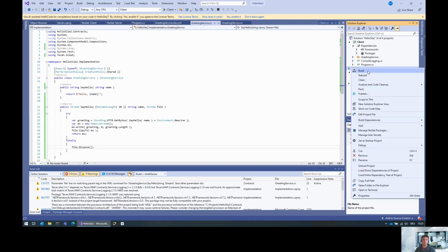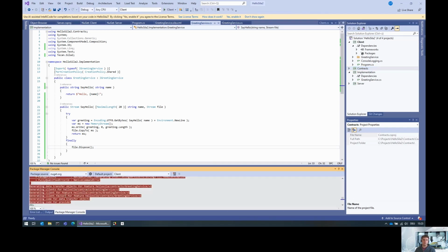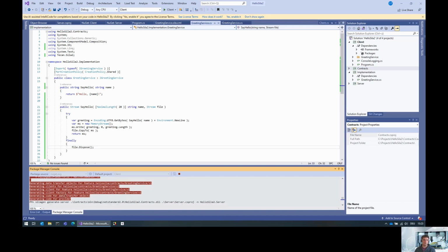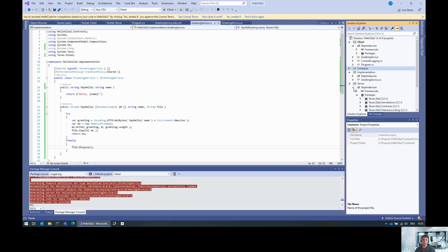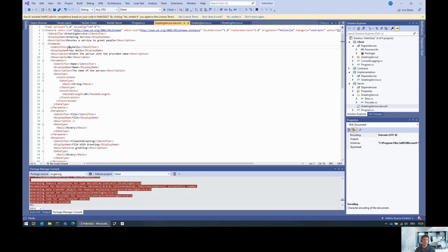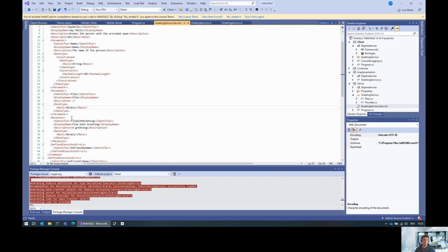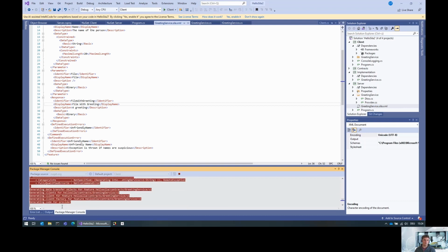So we did change the contract. So next thing is very importantly to build the contracts and then go back to the code generator and regenerate the server code. Once we do this, you'll notice that this say hello command now has a new parameter, namely a file, and that is binary. And the response is this file with a greeting because we overwrote the identifier, and this is also binary. Okay, so then we also need to generate the client.